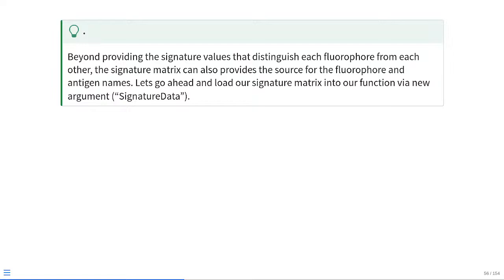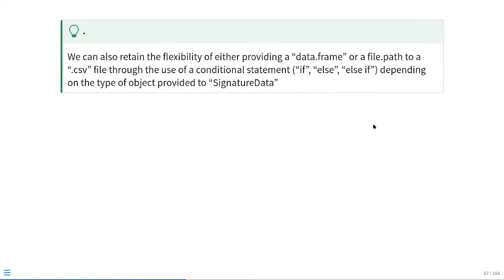So beyond providing the signature values that will distinguish each fluorophore from each other, the signature matrix that we end up providing also contains right now the source of the fluorophore and the antigen names. So first off, we need to go ahead and provide the signature matrix to our old-fashioned unmixed function, which we will need to do via a new argument. In this case, we're going to go ahead and call that one signature data. And then also we want to retain some flexibility in terms of whether we provide this directly as a data frame object or just a file path to a CSV file somewhere in our system. So we could set this up with a little conditional statement, the if, else, or else if kind of statements, so it would handle whatever type of object we end up passing to signature data.